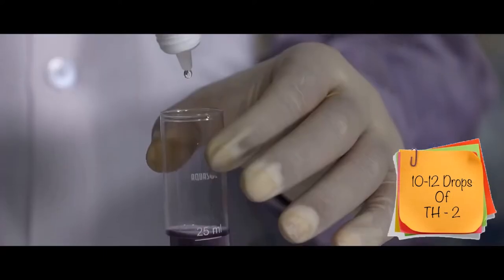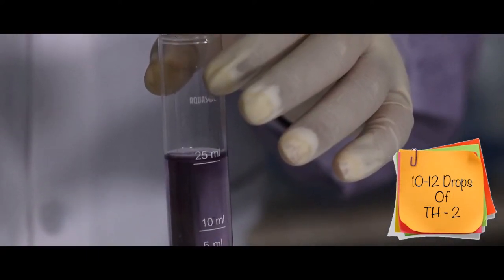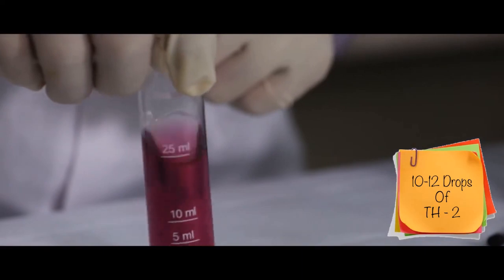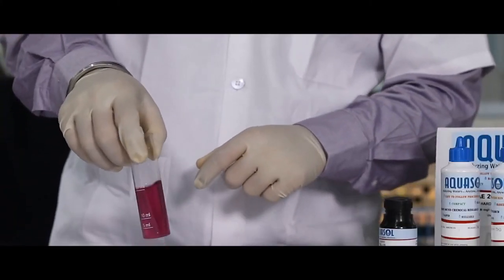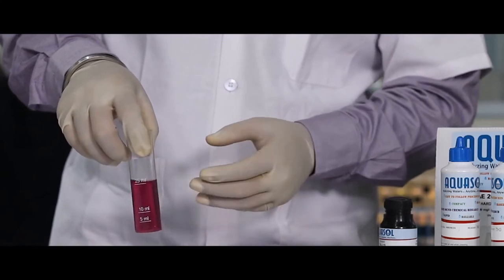Add 10-12 drops of TH2 reagent and mix well. If the sample is still blue in color, it indicates no hardness present. If pink or red color appears, it indicates hardness present.